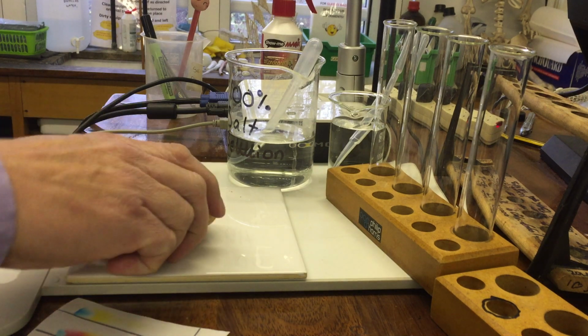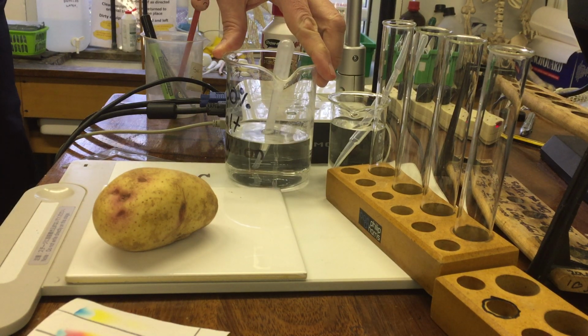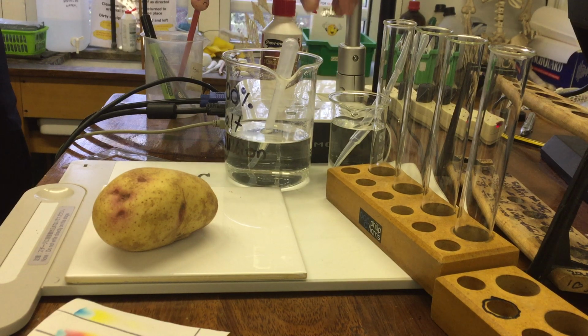Okay, so today we're going to do an investigation of how we measure the amount of osmosis that's going on in a potato chip. So the first bit, what equipment do we need? Well, you've got some salt solution. You can do this with sugar, but we're going to do it with salt mainly because salt isn't sticky, and if you do it with sugar solution, you end up with sticky tables afterwards.